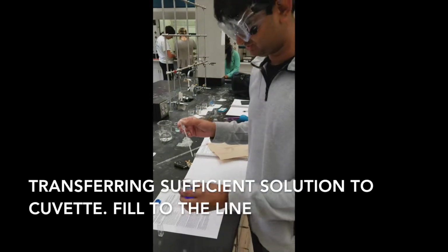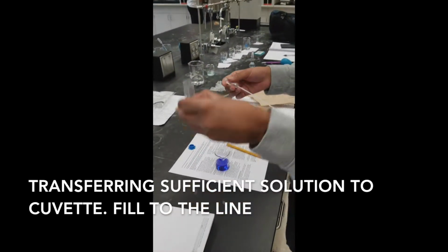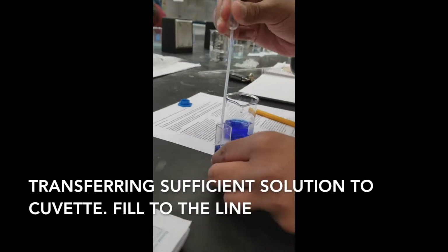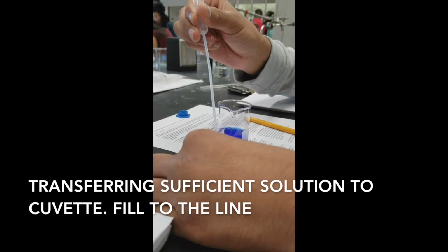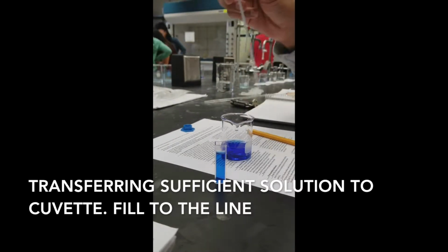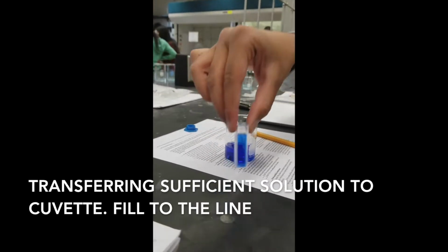Okay, so I'm just going to pour some of this into the cuvette. I want to fill it to the line, as you can see right there. Alright, so as you can see, it's at the line. So that is our first cuvette.